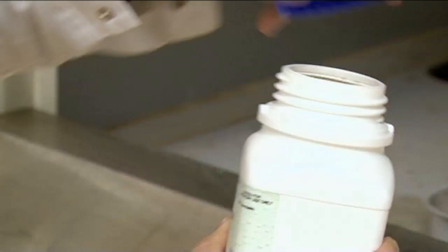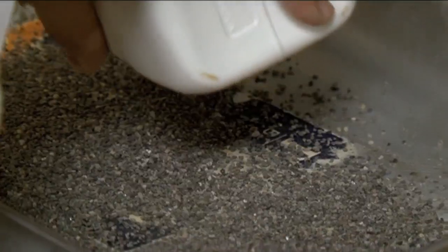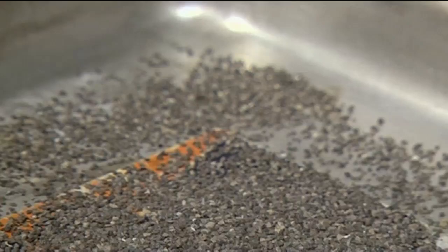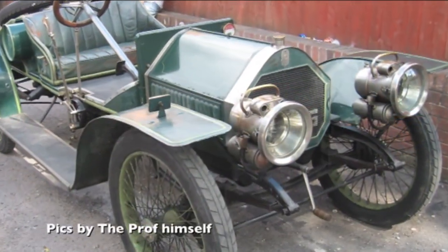We're going to put this into a metal tray — no glassware this time. Sam was doing a reaction of calcium carbide. It's one of these compounds that used to be very common, but now you only find it in labs. The reason it used to be common was that it was used for lights, for cars, and also for bicycles.